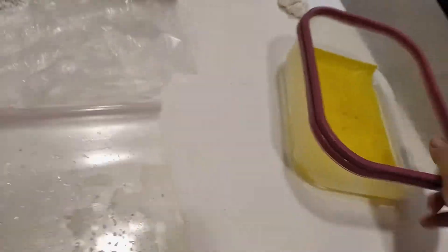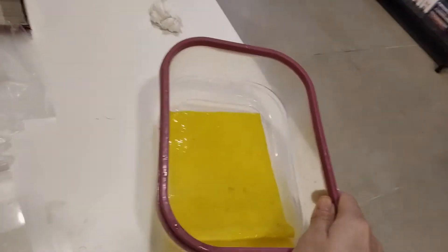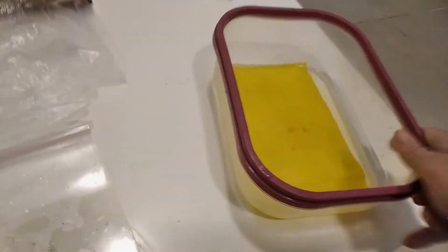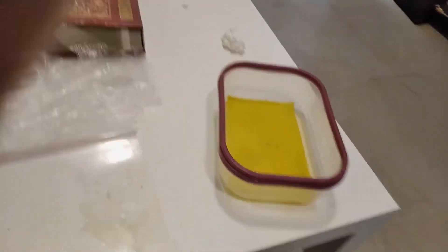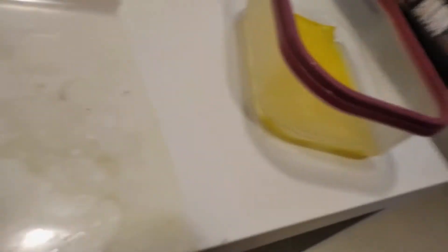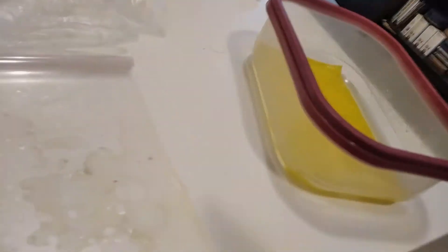I don't know exactly how they fail. Let me drop it in here and shake it. Now you can really see that polymer start to develop — there's a gel-like film on the surface, which is what you want. Earlier it was barely visible; now it's clearly there. After you do this, you fold it the usual way, then wash it, and then repeat. What I'm going to do is coat this a few more times and show you the acid washing step.